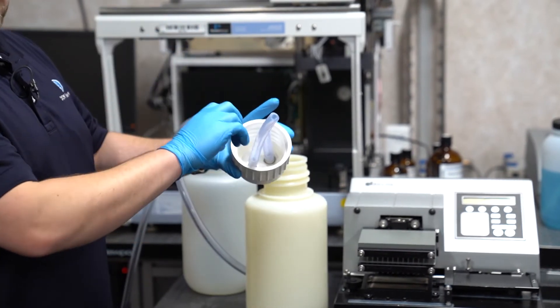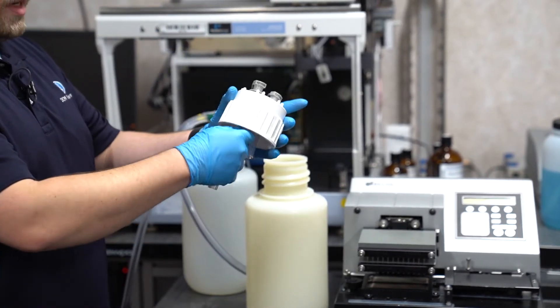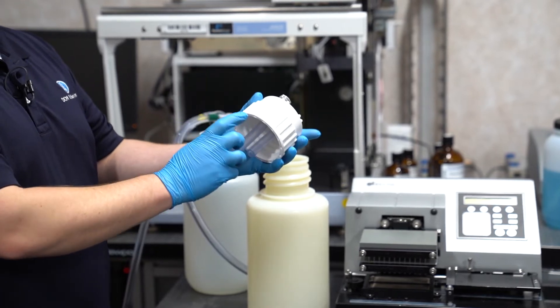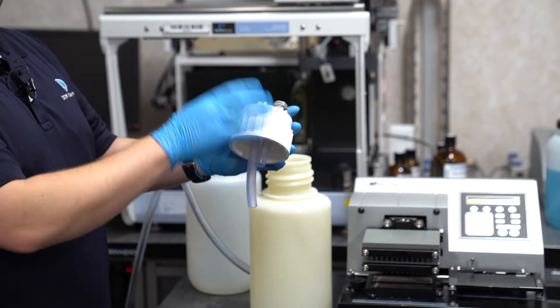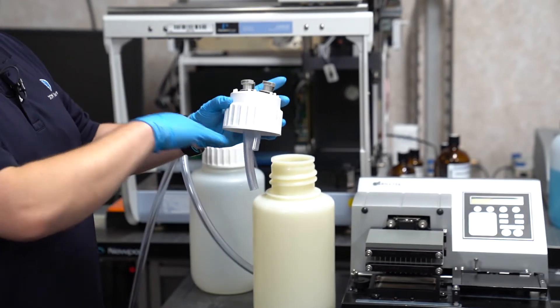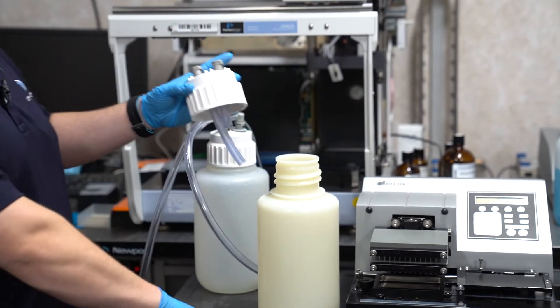And to best inspect the system, we'll need to remove these lengths of tubing. Remember, the longer length of tubing runs to the inlet, the shorter to the outlet. This is to keep the fluid level below the outlet, so we're not pulling into our waste system.